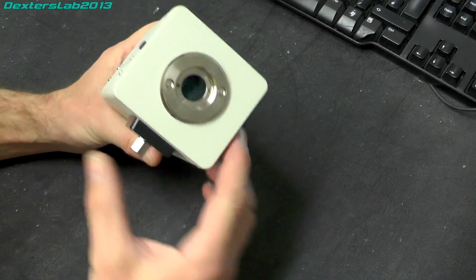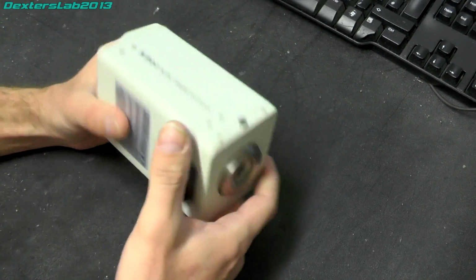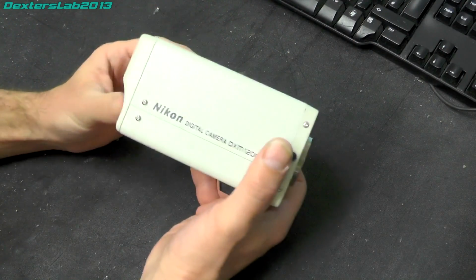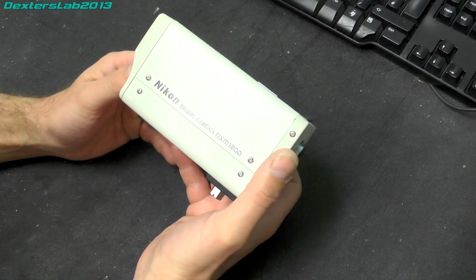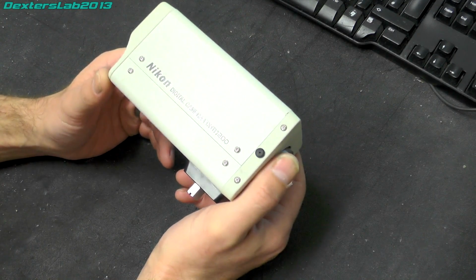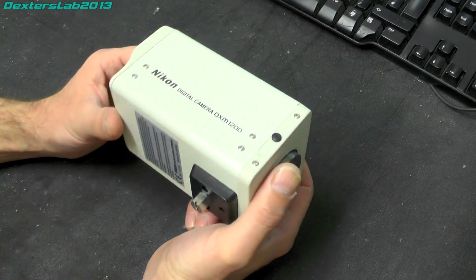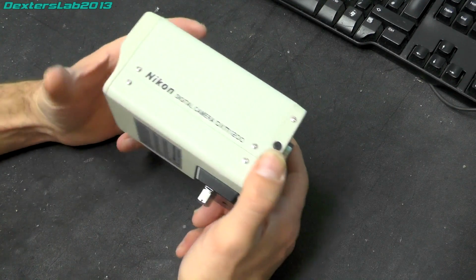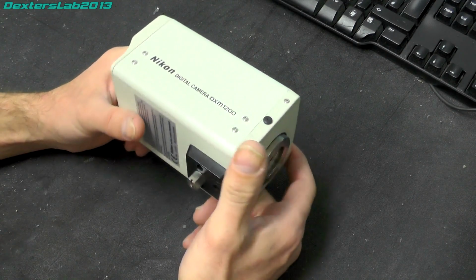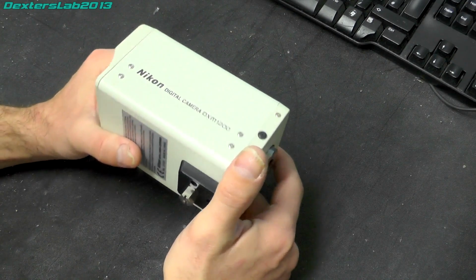Now, the interesting thing about this is it's not a 12 megapixel camera. If you start to go and delve into the actual specifications, the output resolution is 12 megapixel, which is 3840 by 3072, but the actual sensor is 1280 by 1024. And I suppose now I hear everybody there going, oh, it's just interpolated rubbish. And that's what I thought as well, but when you actually start to read into it, there's a little bit more to it than that.